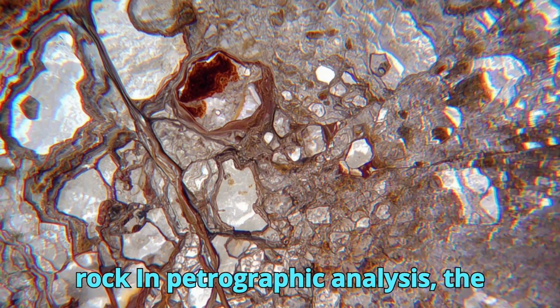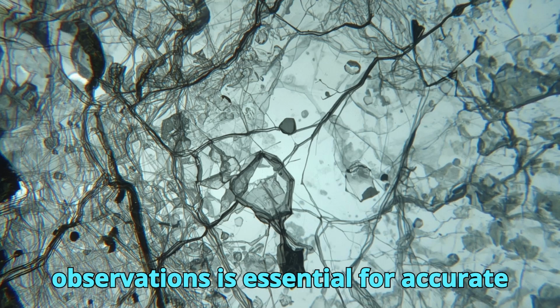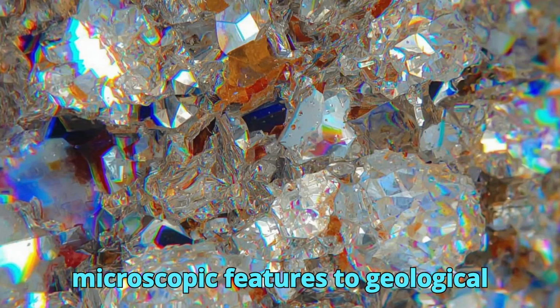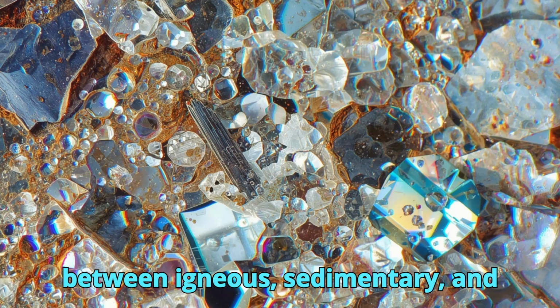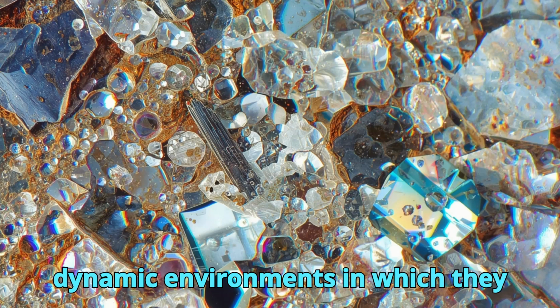In petrographic analysis, the integration of textural and structural observations is essential for accurate rock identification. By linking microscopic features to geological processes, geologists can distinguish between igneous, sedimentary, and metamorphic rocks and interpret the dynamic environments in which they formed.